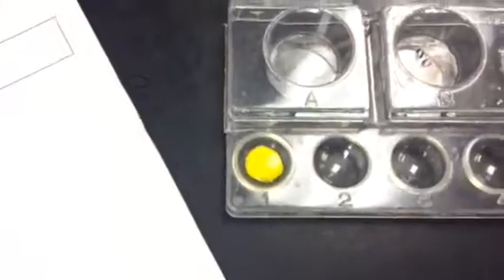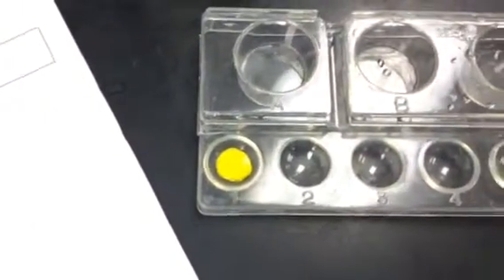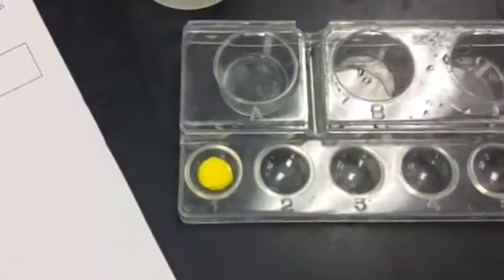And my lead nitrate. So again, just write down the observations, whether this is chemical or physical.